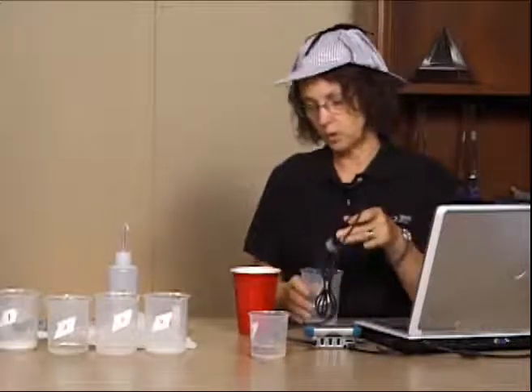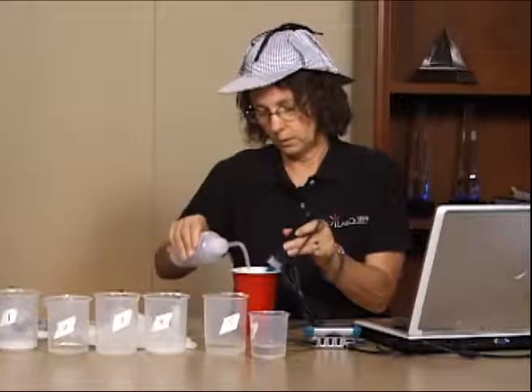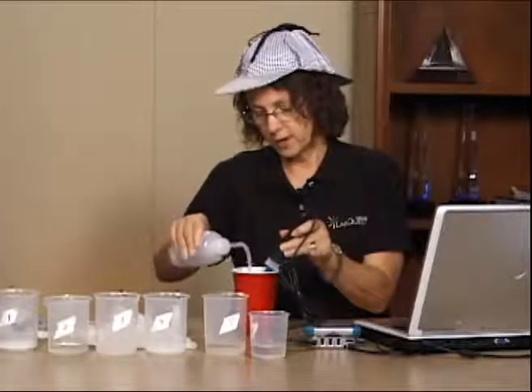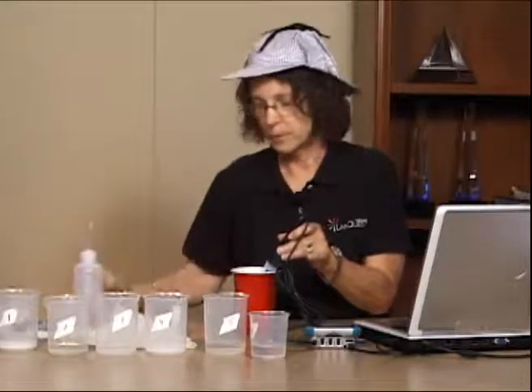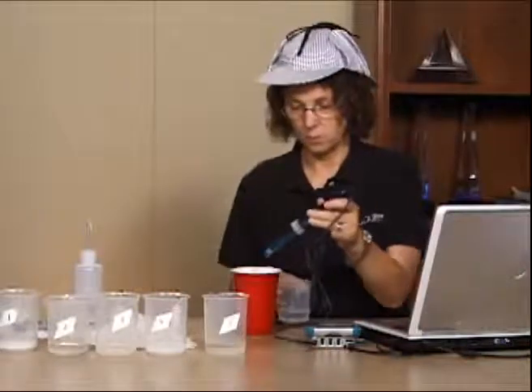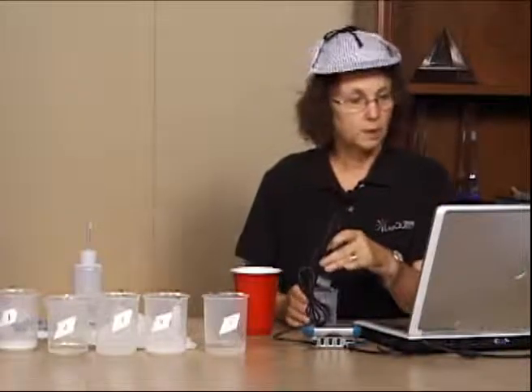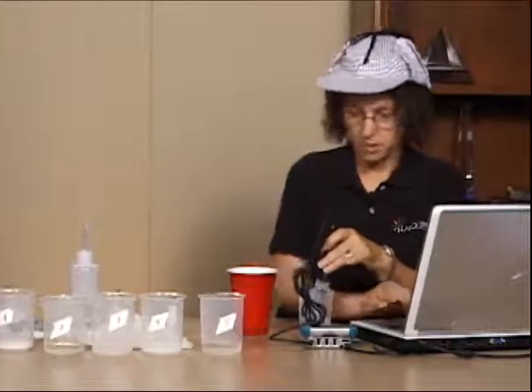And again, all I'm doing is events with entry. When it stabilizes, I keep, and it records for me. And after they've done all 5, they're then going to do the unknown. Now, I'm doing 5. You could obviously have 10 or 15 of these if you wanted to do many more, and that's really up to you. And so here we go. This is my unknown now that I'm doing.